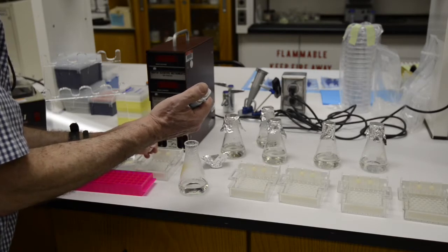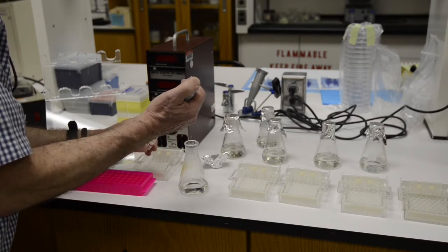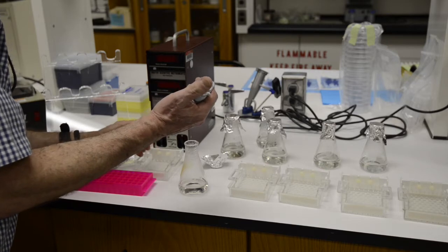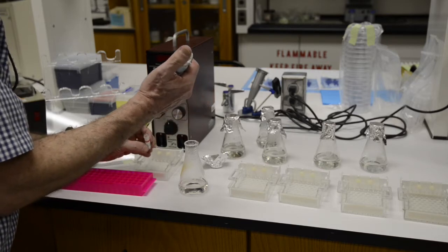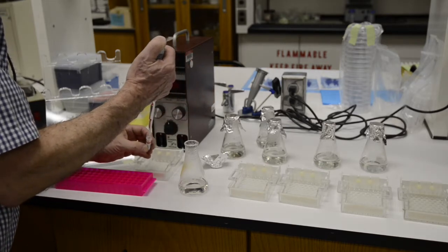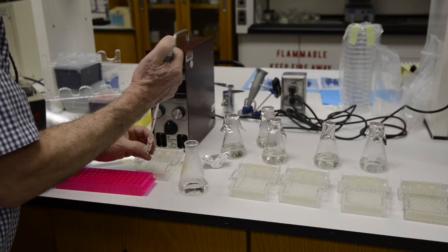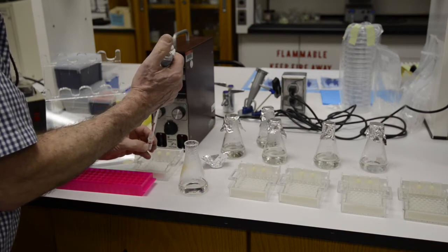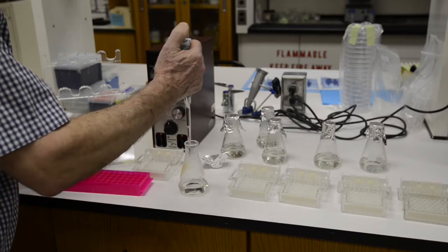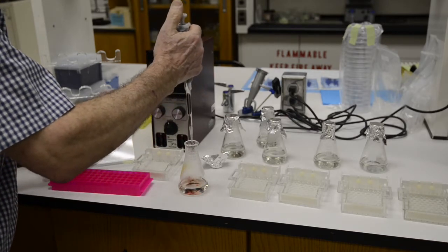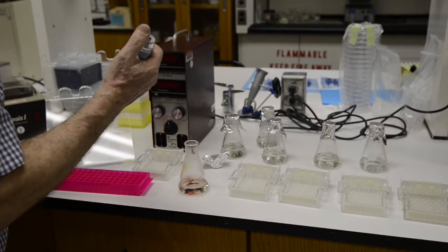And then added to that agarose is five microliters of a dye. Gel red is what we're using. It's a relatively benign dye. This is going to allow you to visualize, to actually see the DNA in the gel.